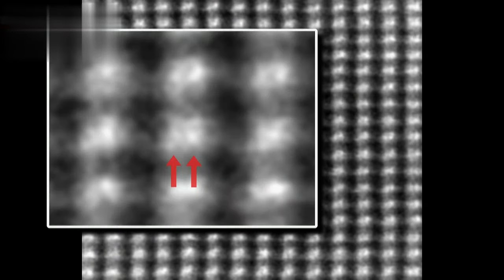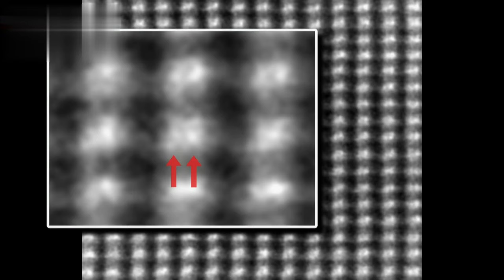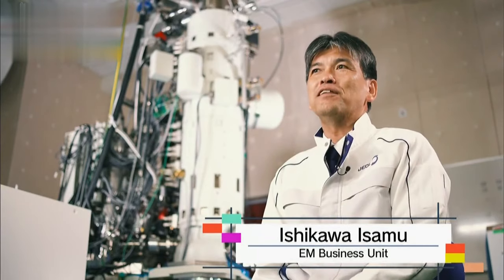It was even able to observe atoms that previously appeared to be one unit but were actually made up of two parts. There is a real need around the world to observe and research at an atomic level. To illustrate: imagine a ping pong ball on the Moon — being able to see that 3.5 cm ball from the Earth is the level of magnification that researchers need.